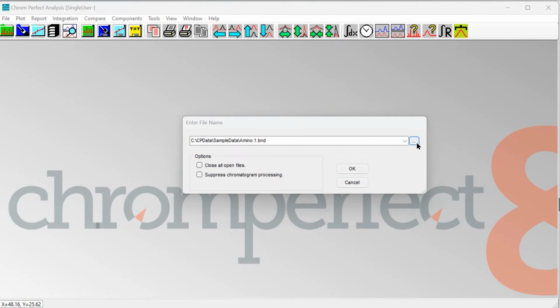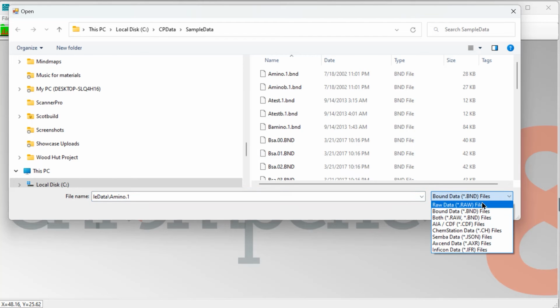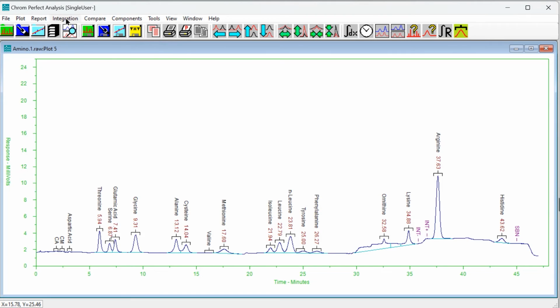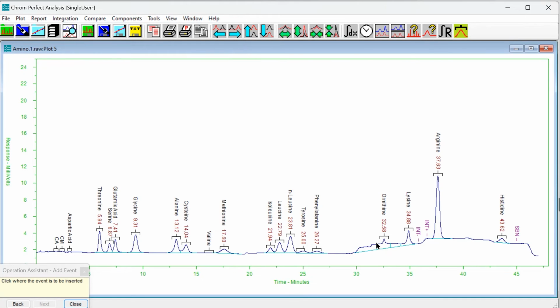Let's reopen our original raw file. Remember first to check the file type is correct. I am going to add an integration timed event, as manual integration settings are not saved to a method. A simple set baseline now event is suitable for this illustration. This time, rather than saving the changes to our bound data file, we will instead save the method file.